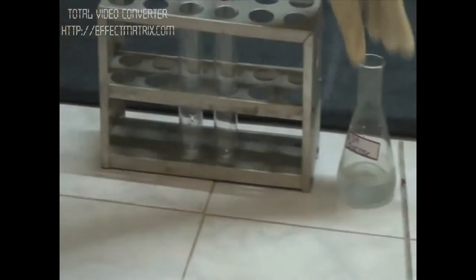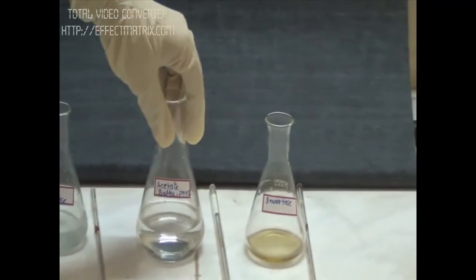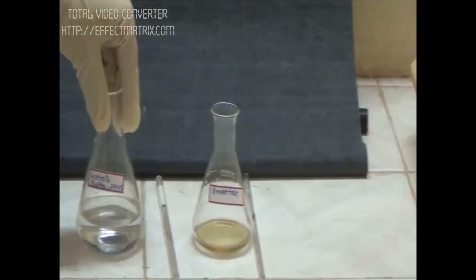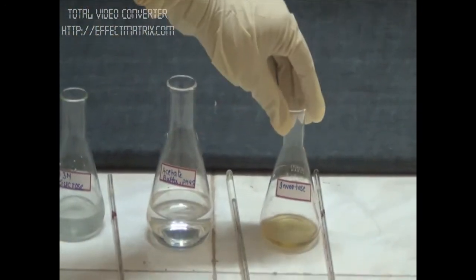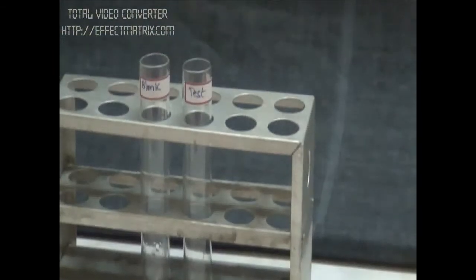We have our reagents: substrate sucrose, acetate buffer with pH 4.5, and enzyme invertase. First, we'll add 1 ml of substrate to both tubes - blank and test.